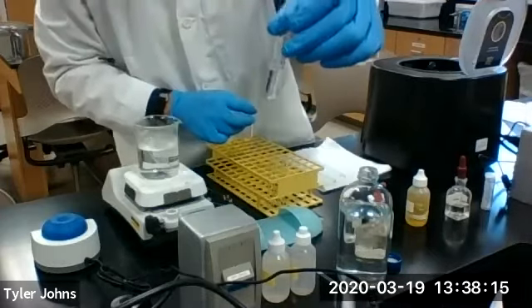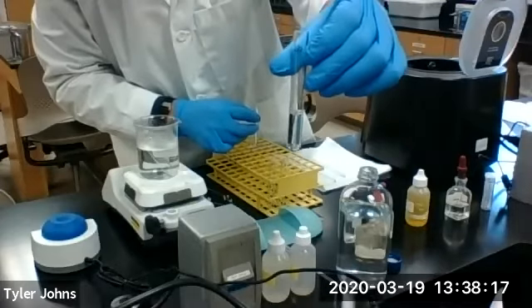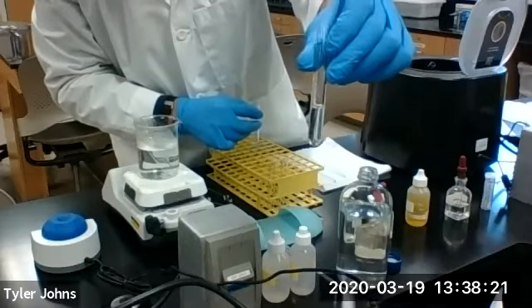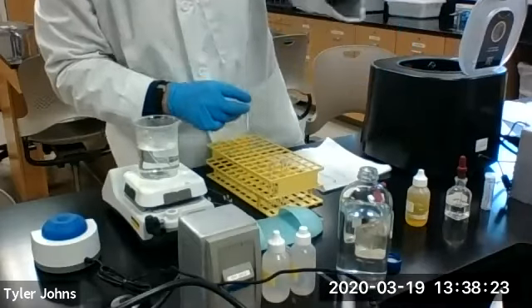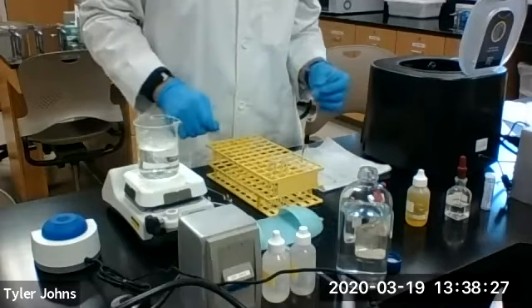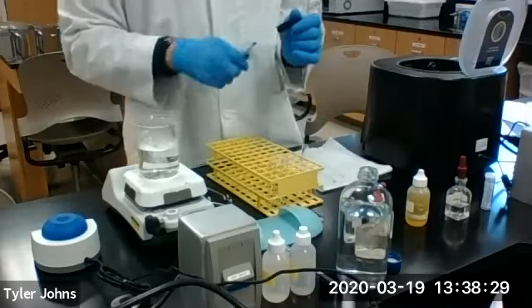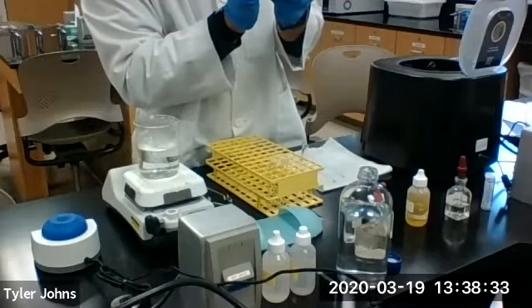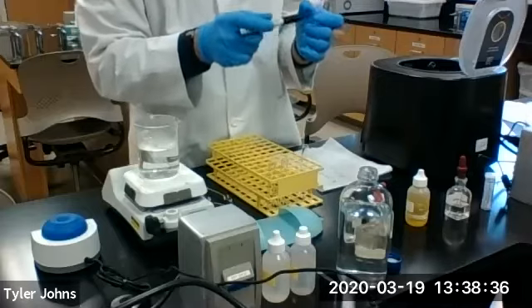This solution is solution 2, or S2. We will save this for further analysis of the lead ion. The remaining residue is residue 2, or R2.